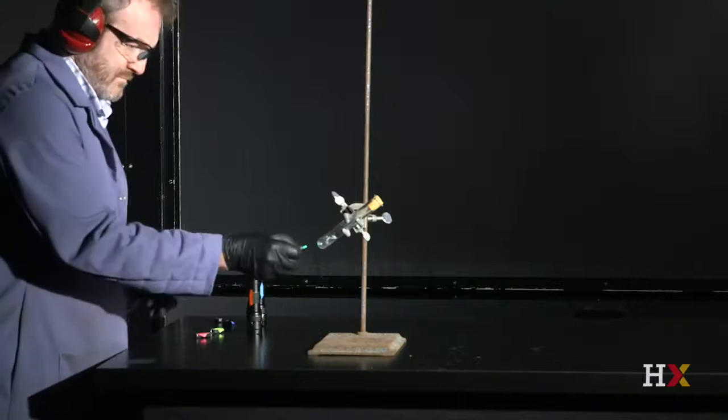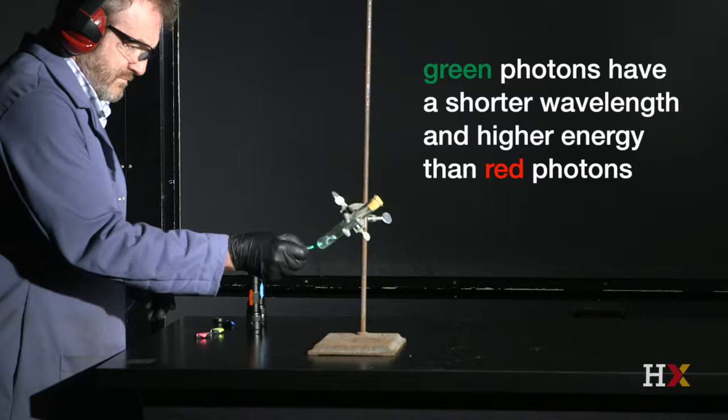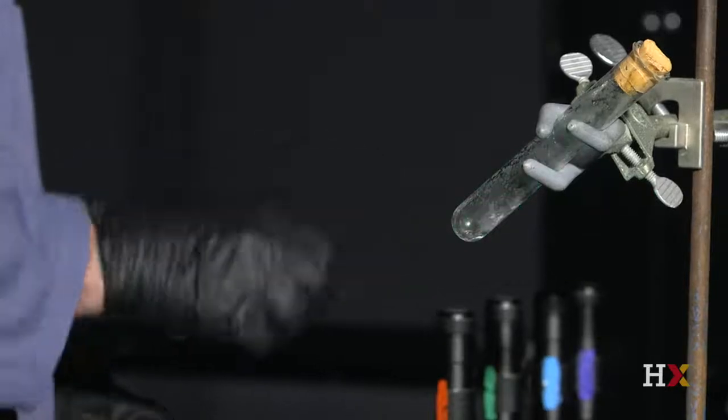Next, we see what happens when we use green photons instead. Green photons have a shorter wavelength and higher energy than red photons. Daniel shines a green LED flashlight on the test tube. There is still no reaction.